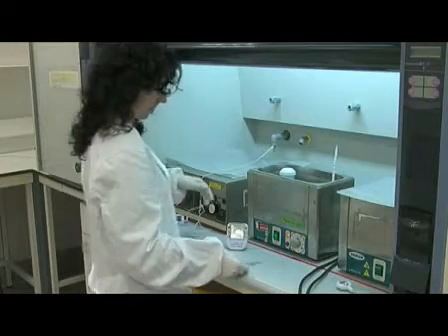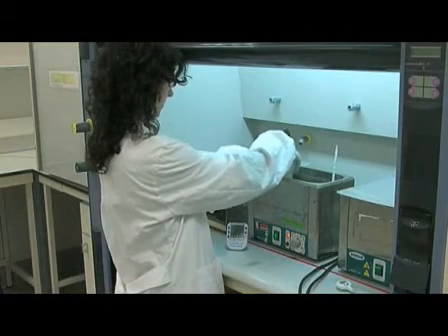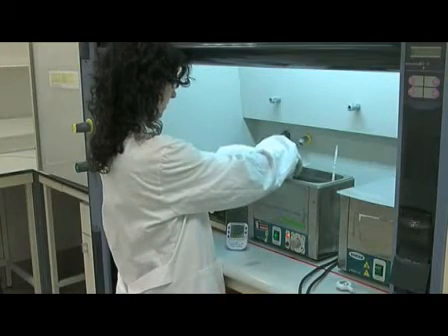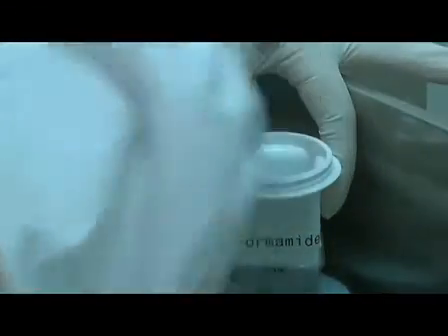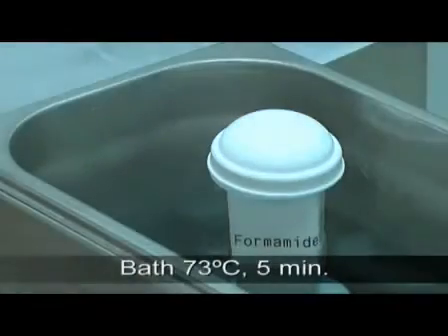For the probe hybridizations, it is essential to work with single DNA strands. This requires a denaturation stage before the addition of the probes, involving an incubation period of five minutes in a formamide solution at 73 degrees C.